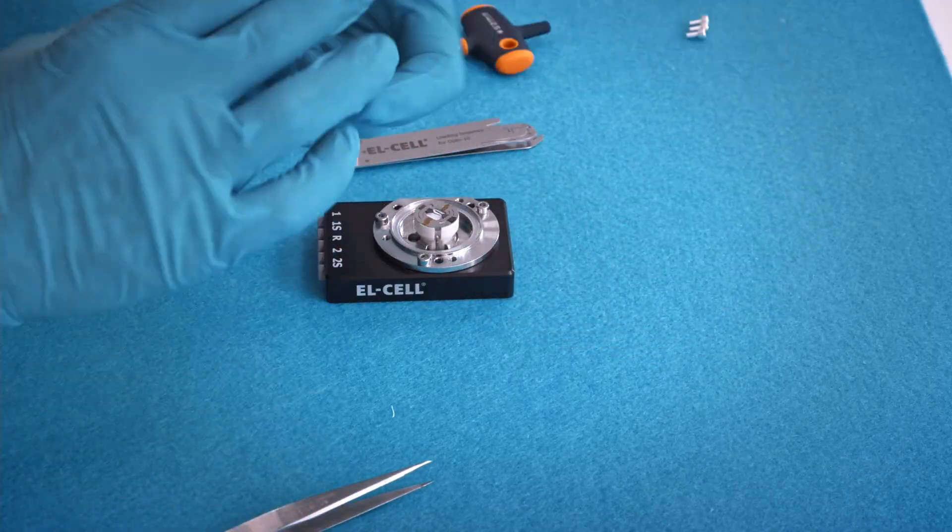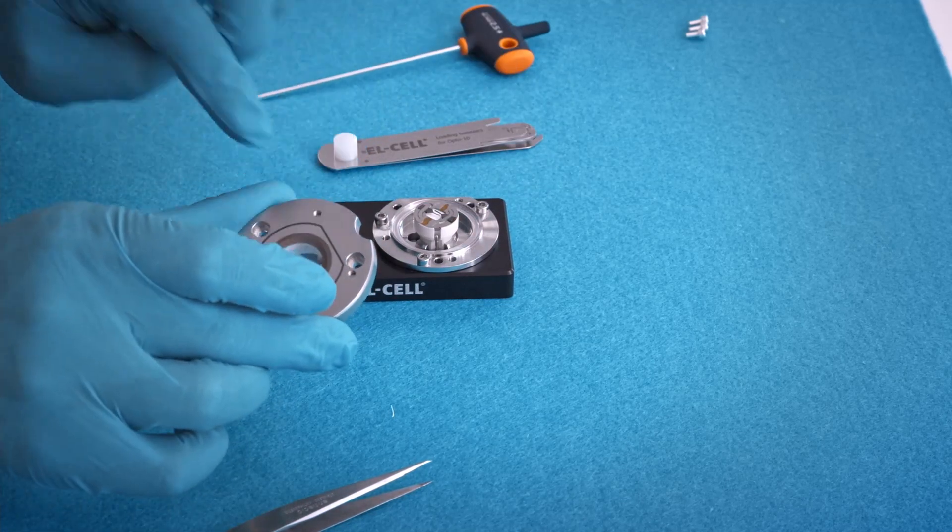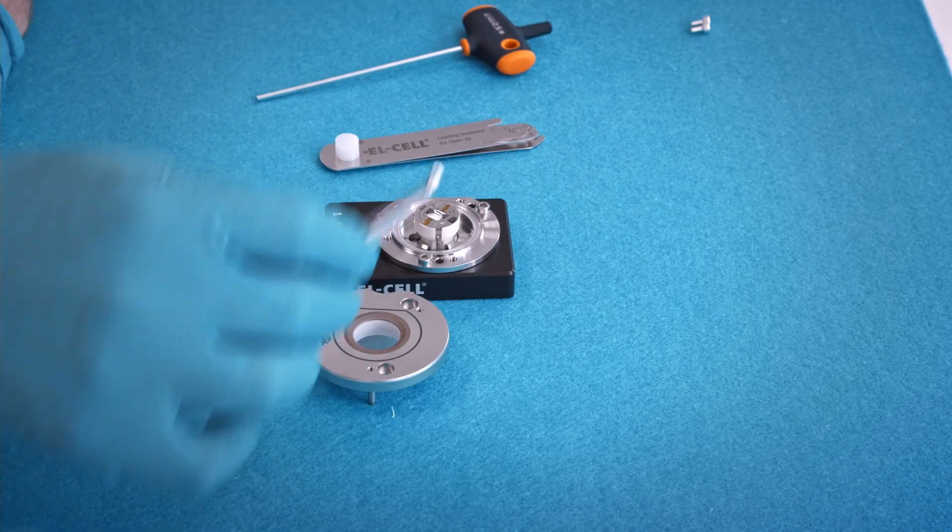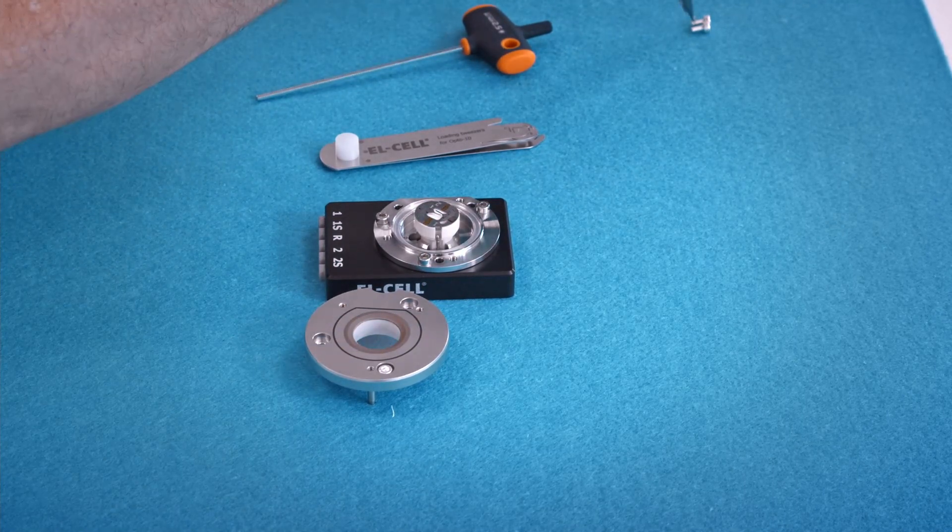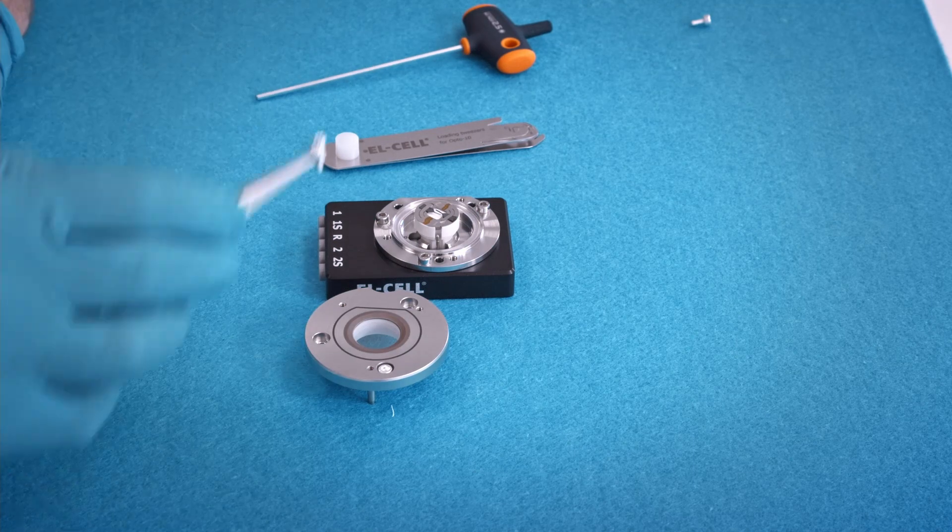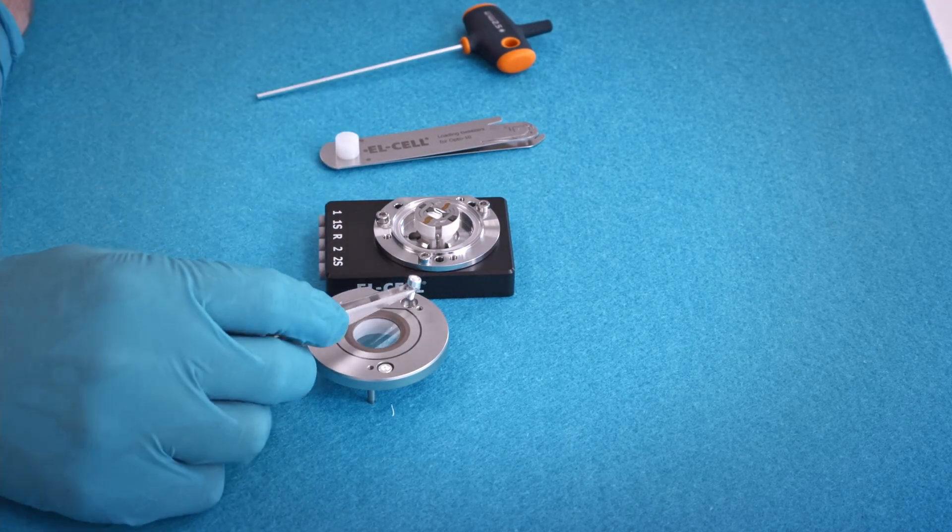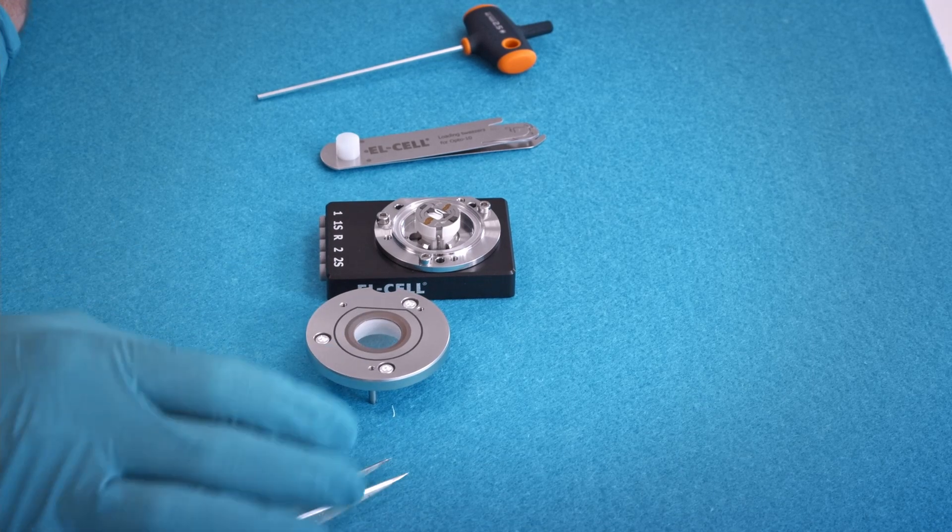Attach the cell lid. The screws are plated with silver to prevent excessive friction when you attach the lid and when you screw in.